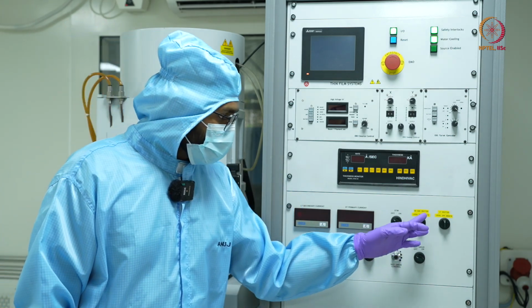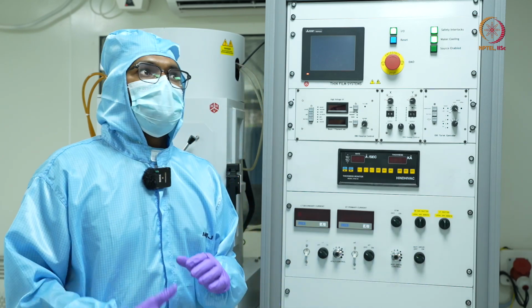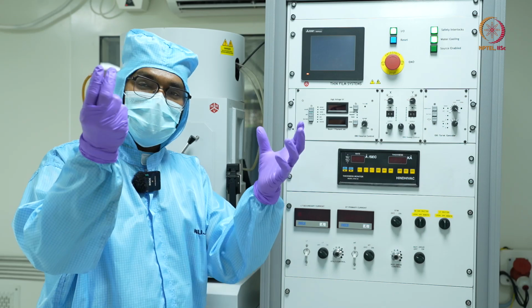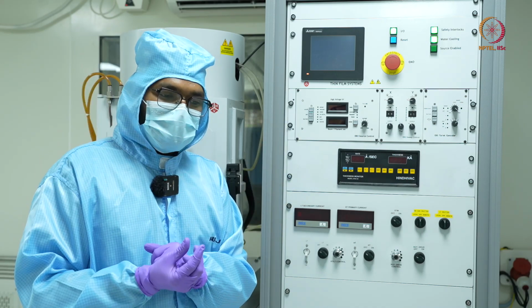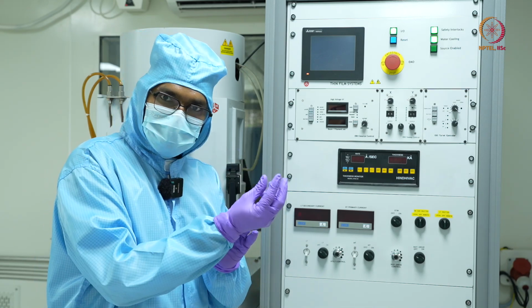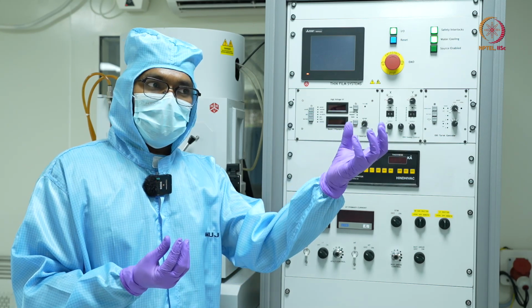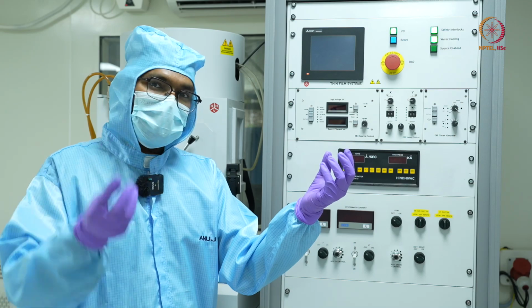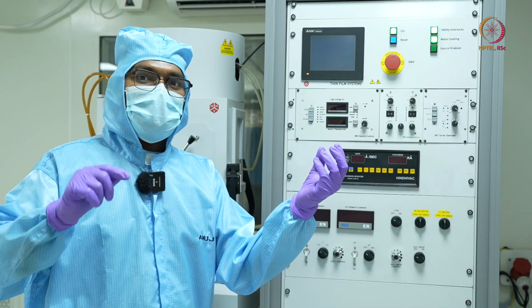Okay, now we have here something called the rotary drive. When we see the chamber, you will see there is a substrate holder, and at some locations I will have my sample. It is possible that at some location further from my source, the deposition might be a little less, and at a position directly above my material source, the deposition might be higher.